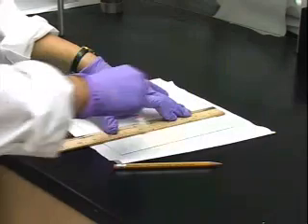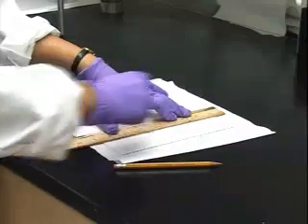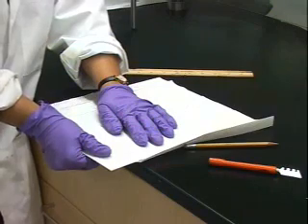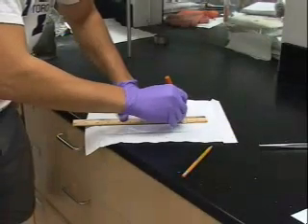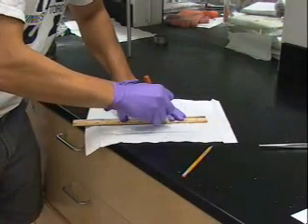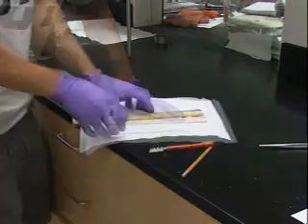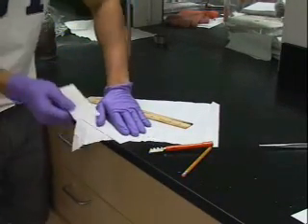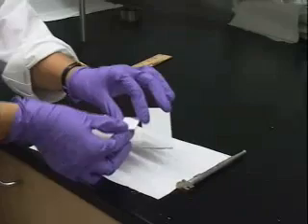Next, use the glass cutter to score a line in the plate. You may be tempted to score the plate repeatedly to deepen the cut in the glass. But this will actually make it more difficult to break the plate in a clean, straight line. Instead, firmly score the glass with one sweep of the glass cutter. And using the edge of your bench for support, break the plate in a clean, straight line. Continue cutting the long strip into individual TLC plates until you have amassed a nice stockpile.